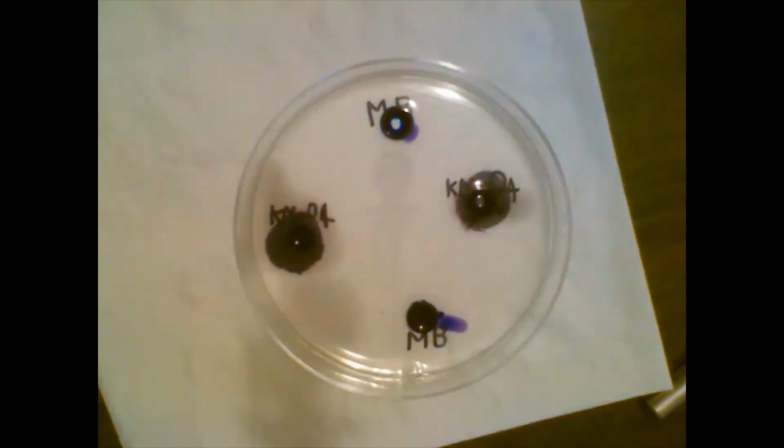So for that table on page 68, you were going to write in circle 1 and circle 2 as 15 for potassium permanganate, that KMnO4. And for the methylene blue, you'd put 7, and then you're going to take the average. And then it's going to ask you which substance diffused further, the potassium permanganate or the methylene blue. You can clearly see from here that the potassium permanganate moved much faster.